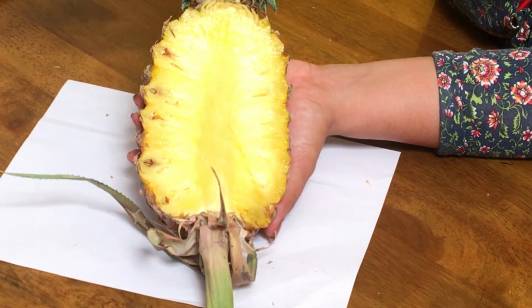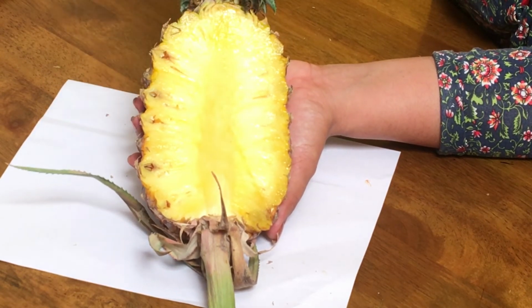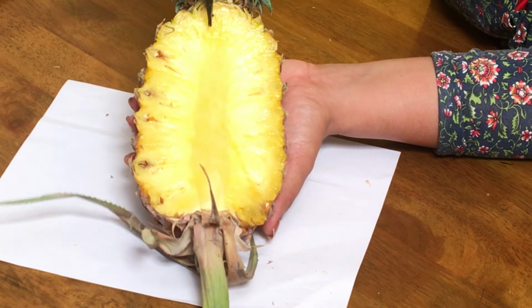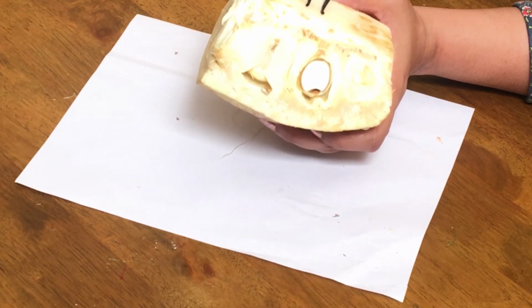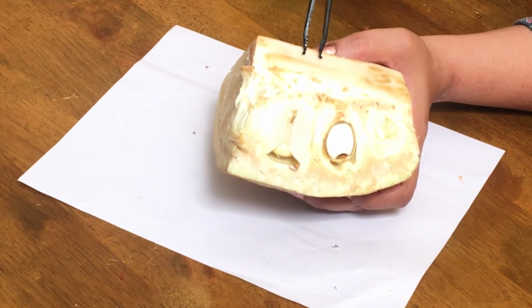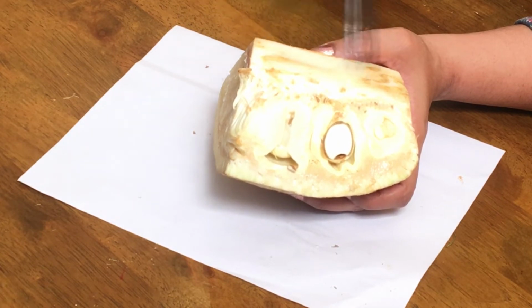And these are the bract of the inflorescence, and this is the inflorescence axis. So since many fruits are combined together here, and each fruit was developed from separate single flowers on an inflorescence, it is called a multiple fruit. This is a jackfruit, a small young jackfruit which has not yet ripened, but still this is called a multiple fruit because it is formed from many flowers borne on a single inflorescence.